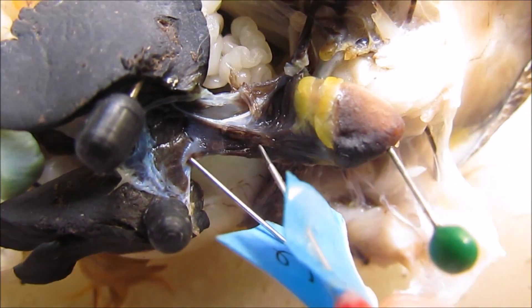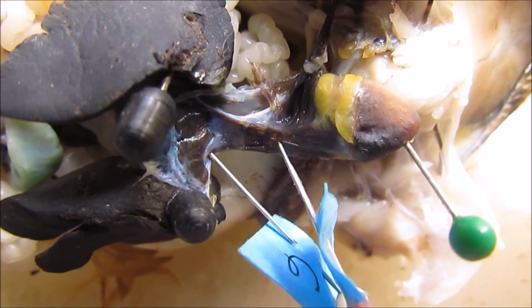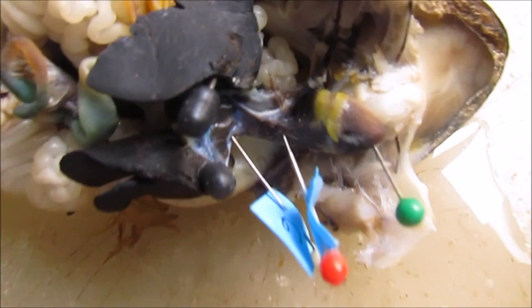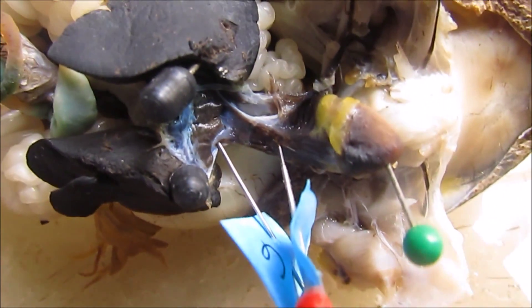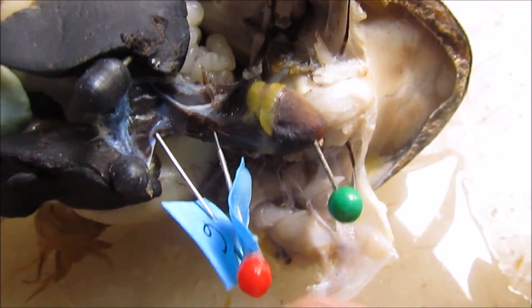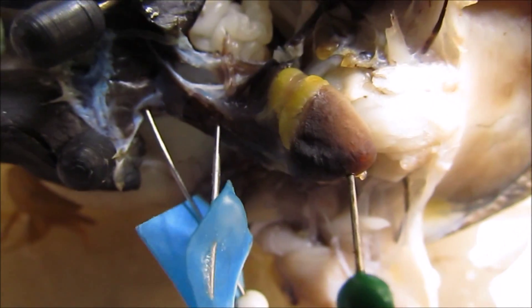So again, this is the postcaval vein, and then this one is the hepatic vein. It goes in the middle of the liver, then back. So this one is the postcaval vein and then this is the hepatic vein.